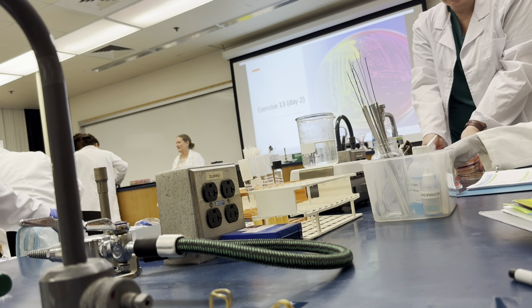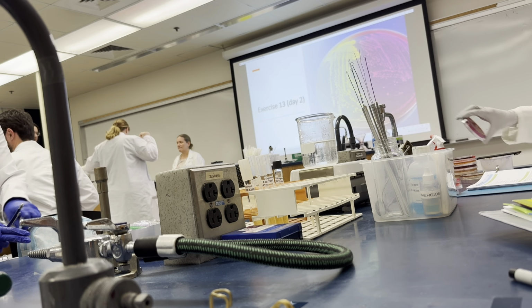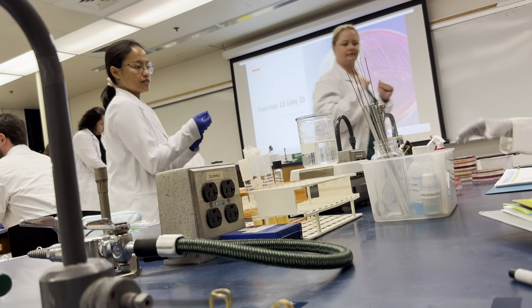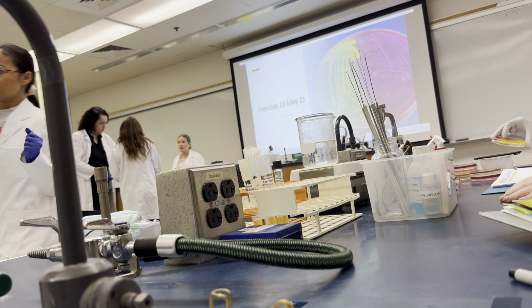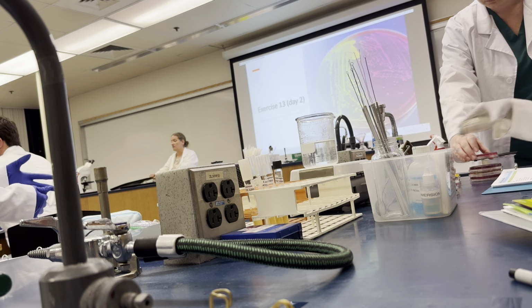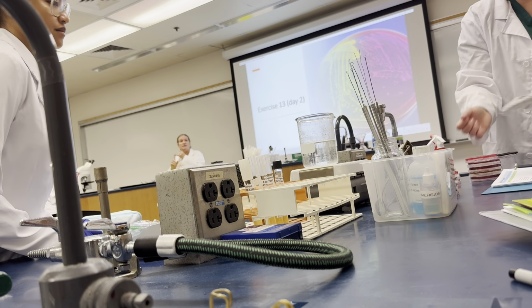So I give you 4 stacks, right? We need one more? Yes. You probably have 4 stacks of 5. What I want you to do is separate those out into 5 stacks of 4 by media, by type of media, because we had 5 medias that we put together here. So group them by the media.